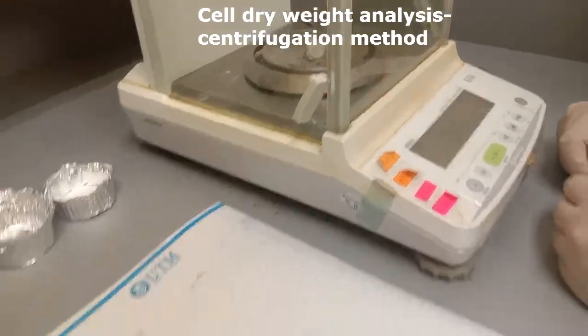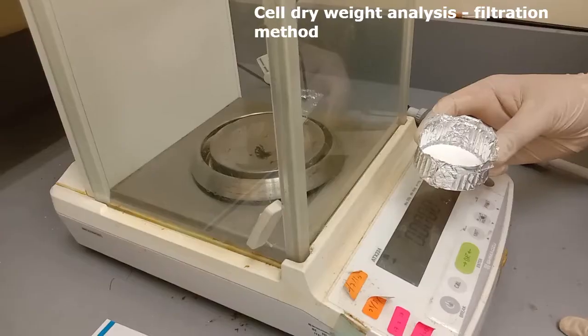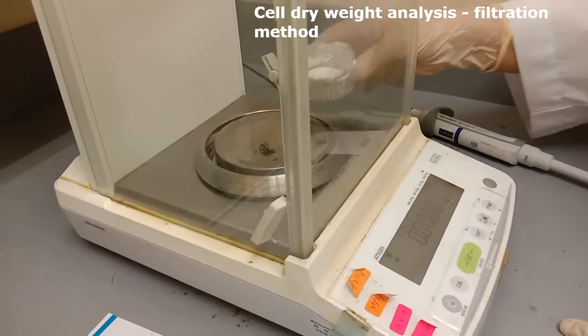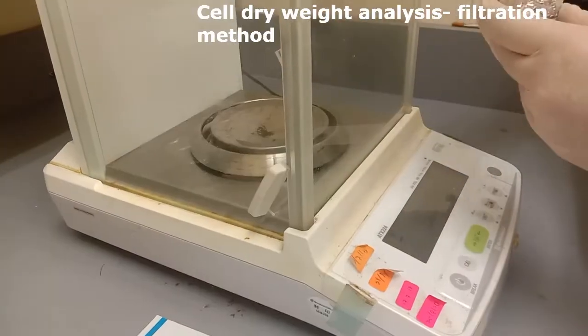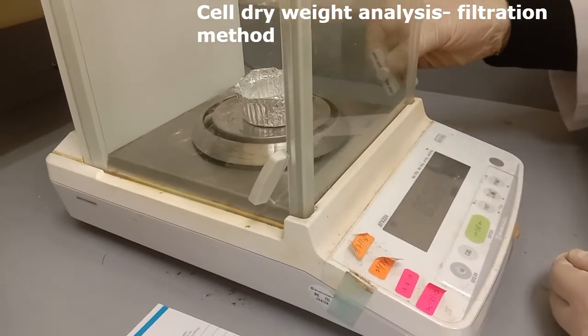For filtration method, place a filter membrane in an aluminium boat as shown here and record the weight. Repeat this step for all filter membranes that will be used in the experiment.